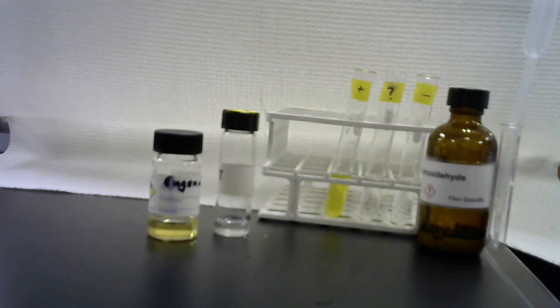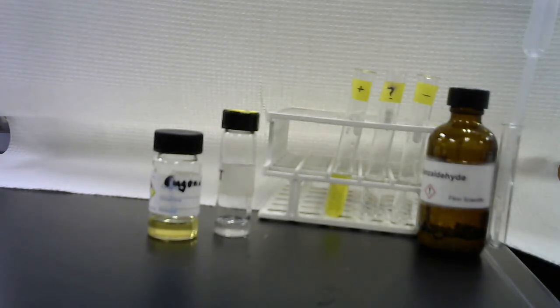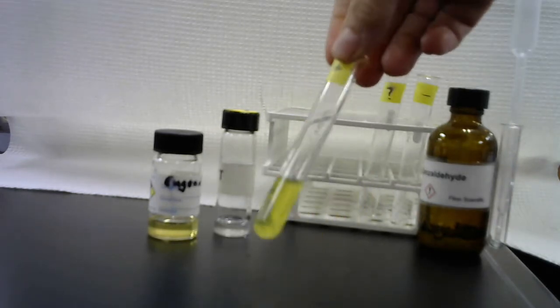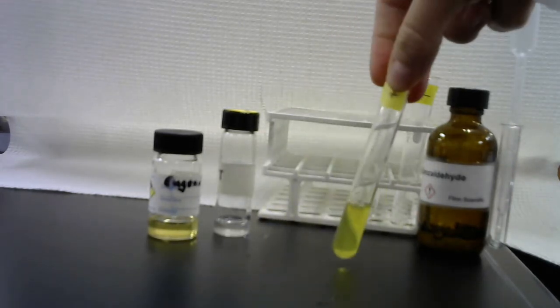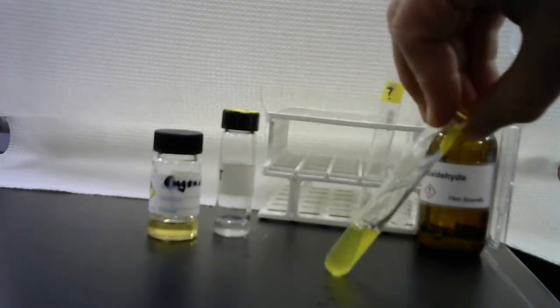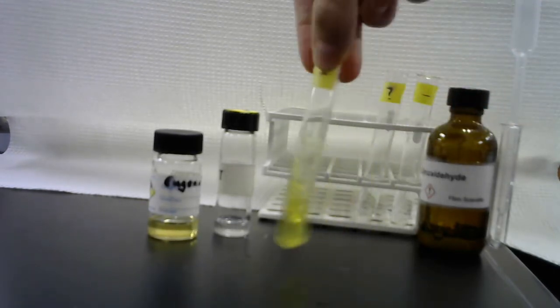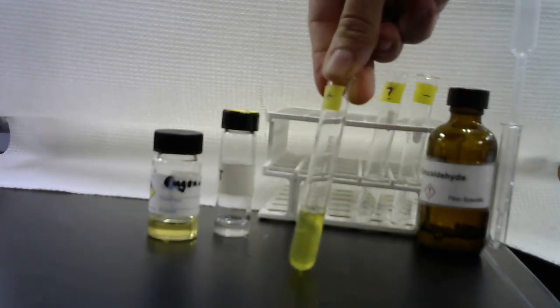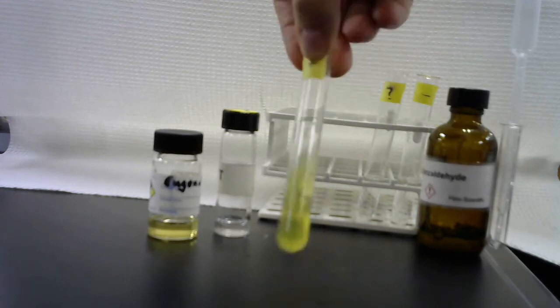And now, like before, we will mix and make observations. Is the substance soluble or not? And what does it look like? So eugenol is known to dissolve in sodium hydroxide. That turns yellow, but it was yellow to begin with. Let's see. Oh yeah, it just dissolves. It's totally dissolved. One phase.